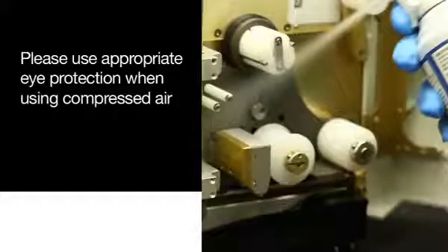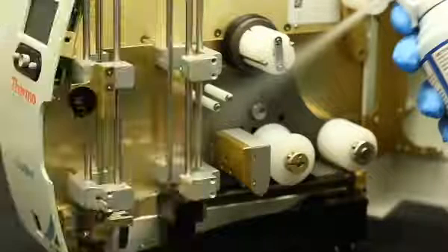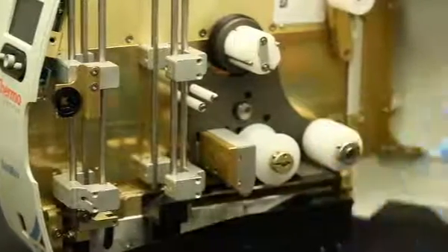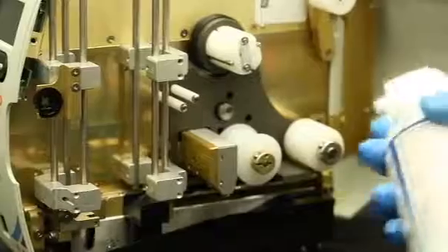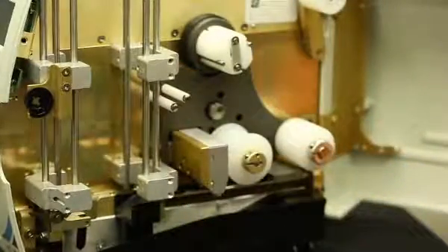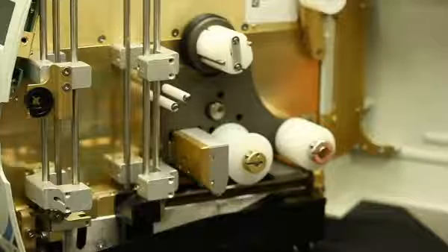of glass dust. Compressed air can also be used to blow some of the dust off, but safety precautions must be taken. Find a place with no other equipment, furniture, or people. Point the airflow away from you and onto the spot in the SlideMate where there is dust.